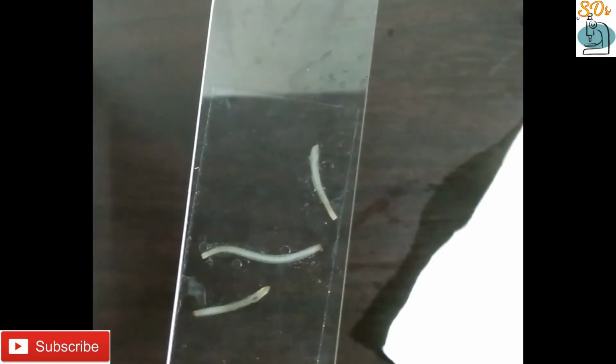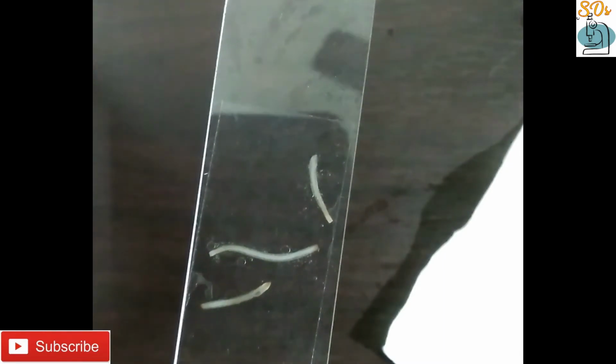Observe and study mitosis by placing the slide under the compound microscope. Focus as desired to obtain a distinct and clear image. Observe it under a compound microscope in 10x objective. Scan and narrow down to a region containing dividing cells and switch to 40x for a better view.